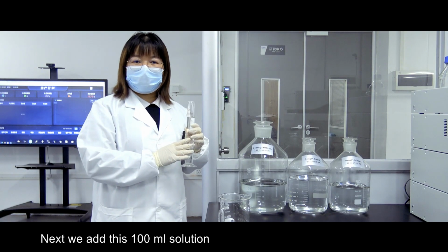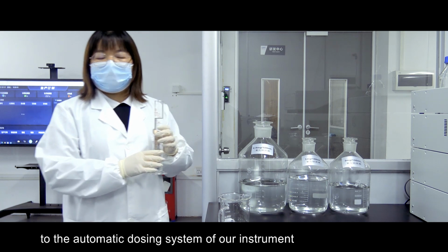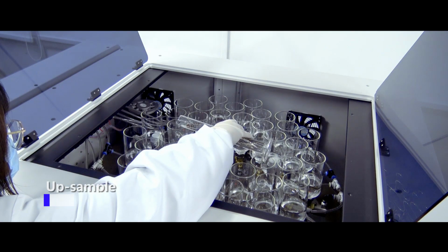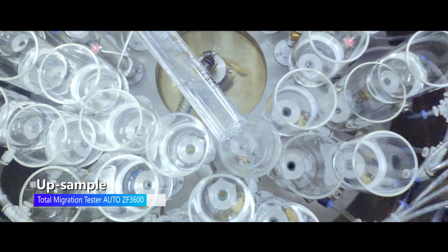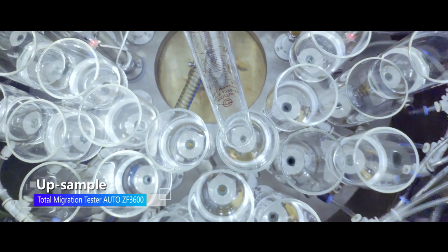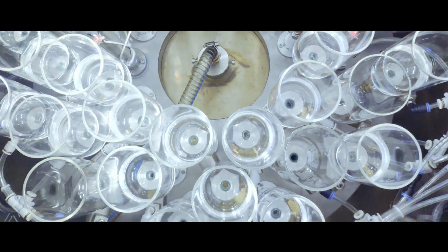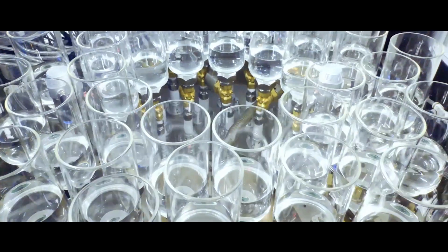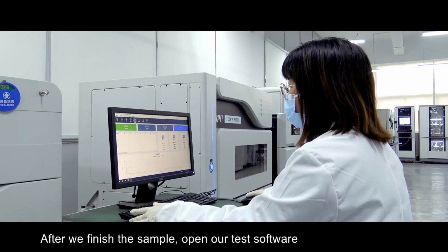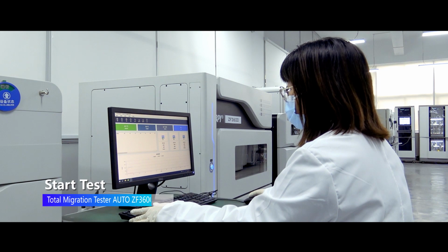Next we add this 100 milliliters solution to the automatic dosing system of our instrument. After we finish the sample, open our test software.